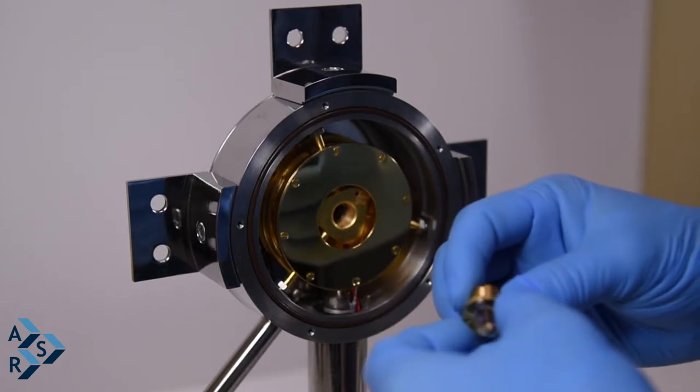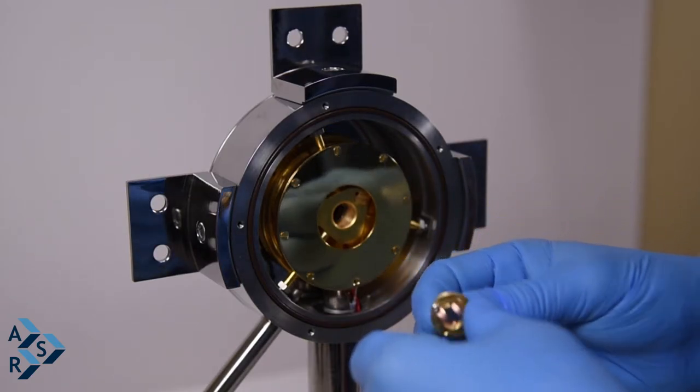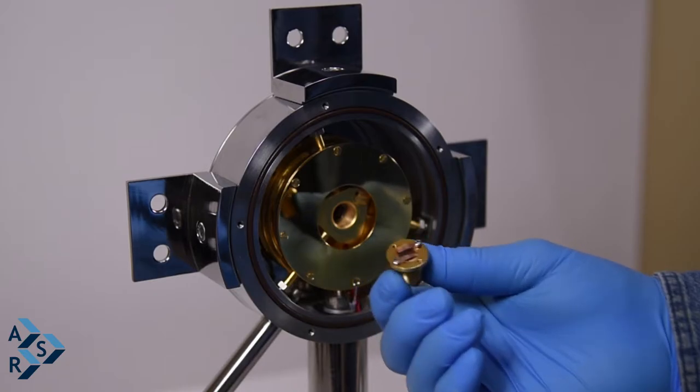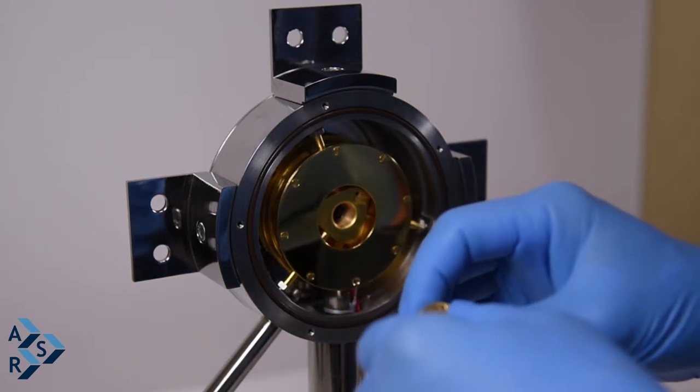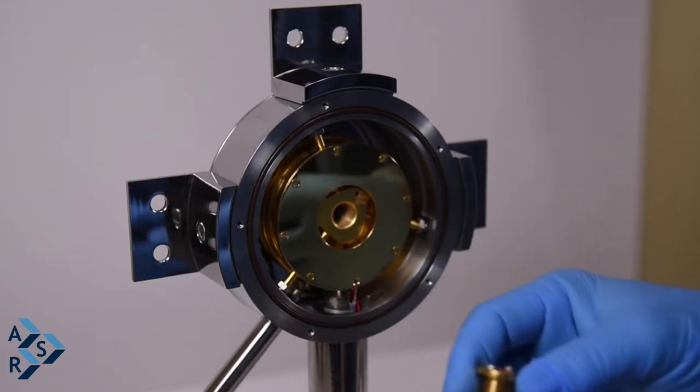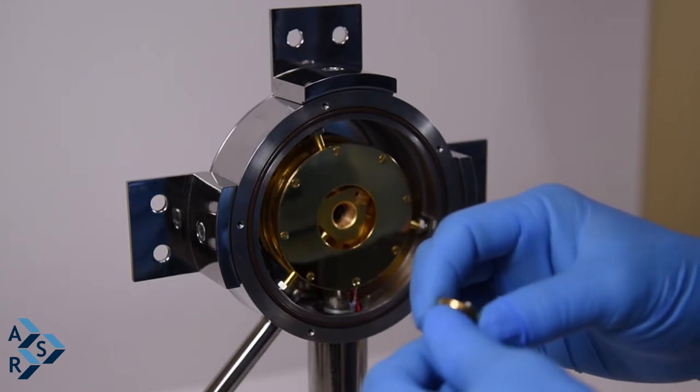We have some sapphire here. And this is actually our third sample holder for this particular system. So we do have a variety of different sample holders. And if you need something specifically, we do custom design.